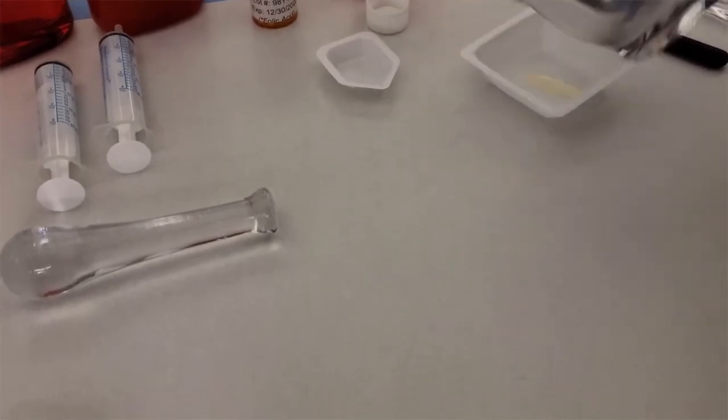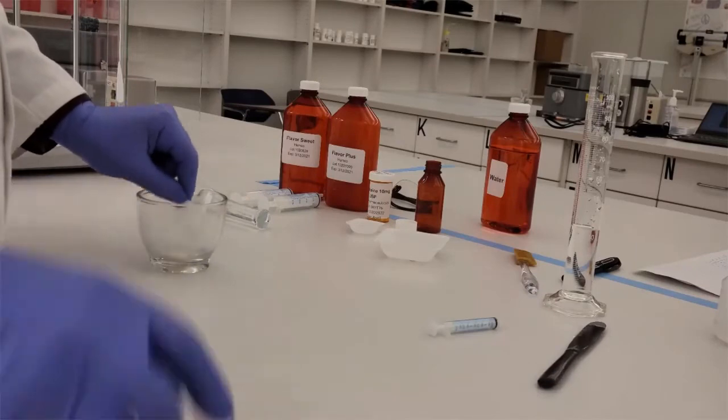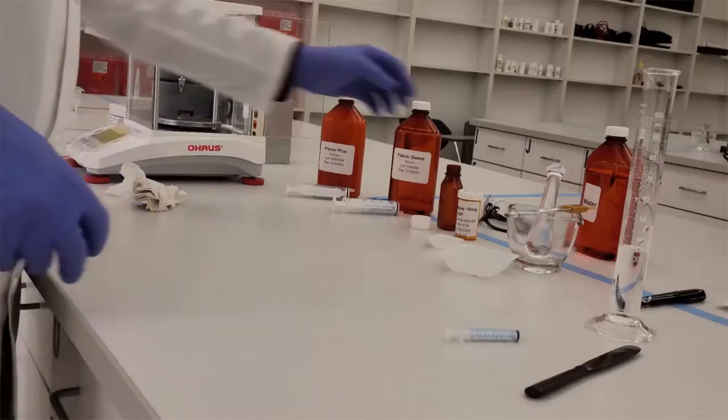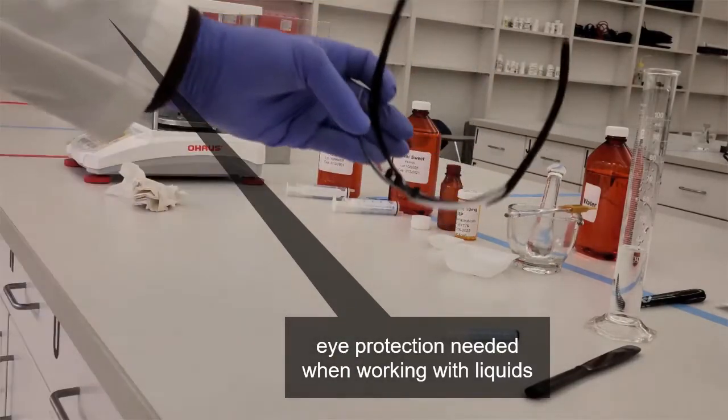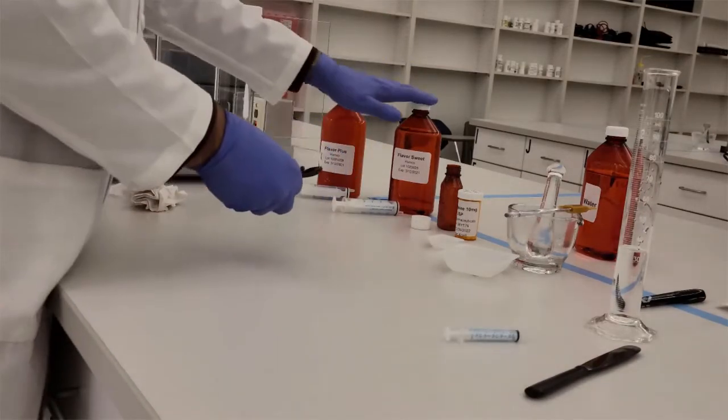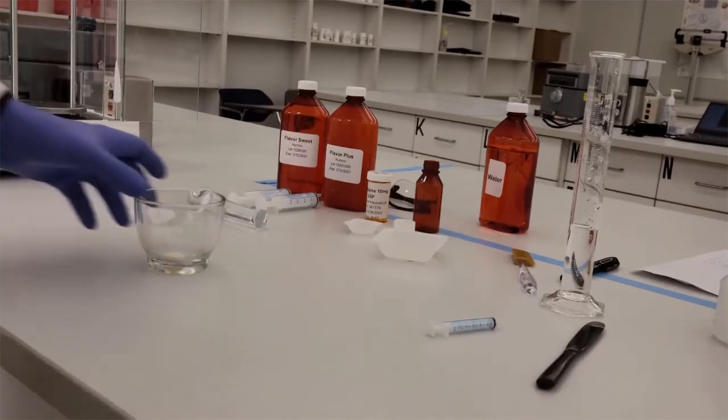Once you're done disposing of it, I can clean out my mortar and pestle. And now I can add in my amount of powder that contains my 35 milligrams of amlodipine. Now I want to make it a suspension. So I'm going to be dealing with liquid. So we need to have eye protection. Glasses will count for our lab as eye protection, but you can still use goggles if needed.